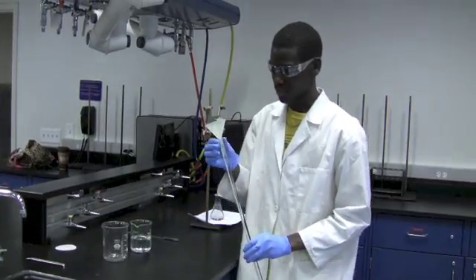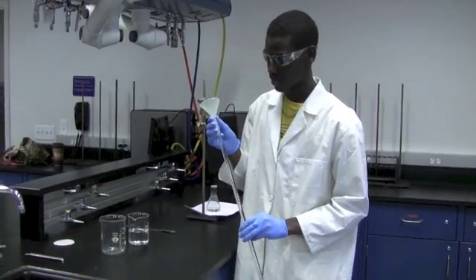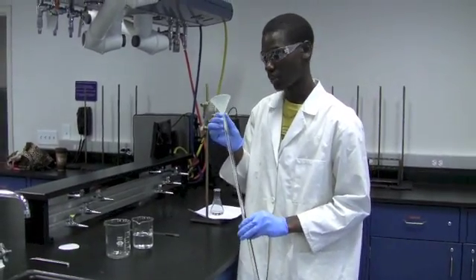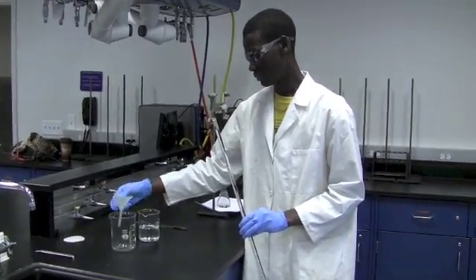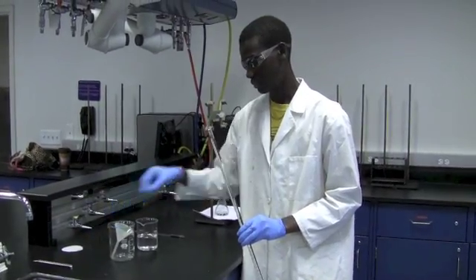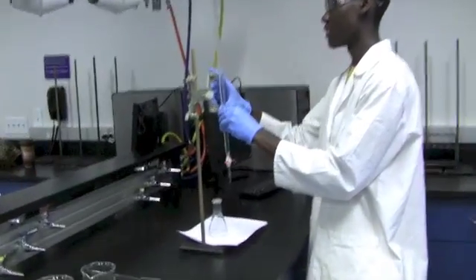Now, remember you don't have to start at 0.00 milliliters to be exact, but make sure to record the initial volume to two decimal places in your lab notebook. After filling up your burette, place it back on the ring stand.